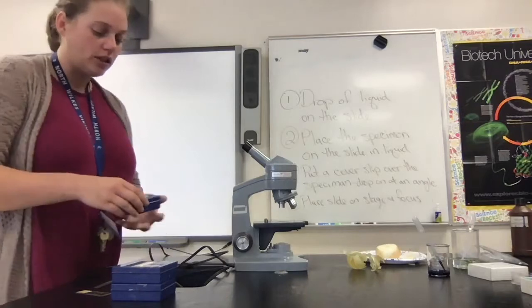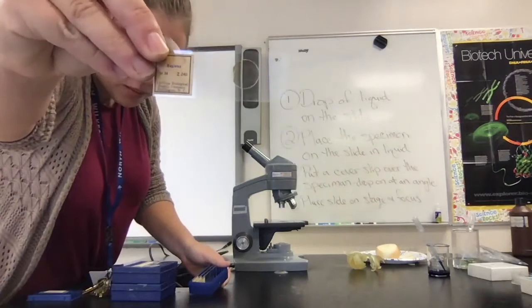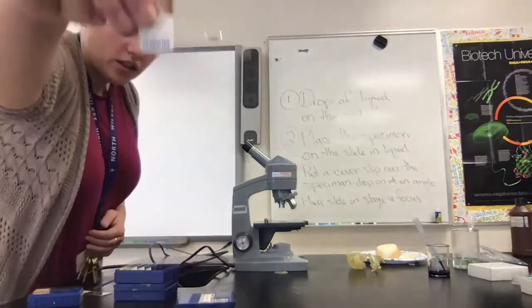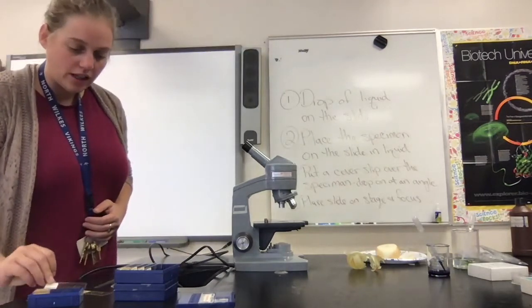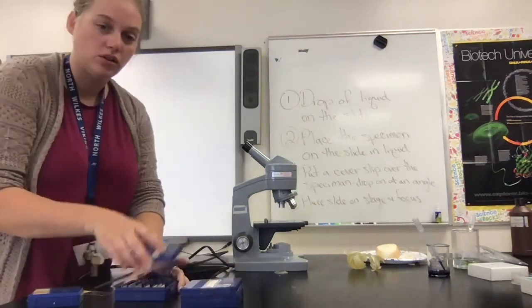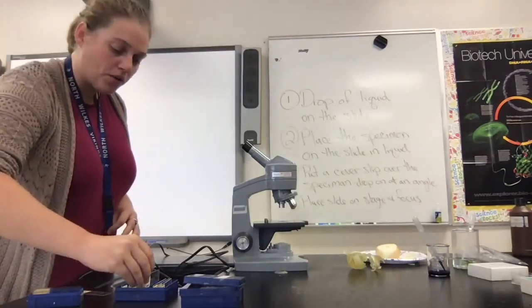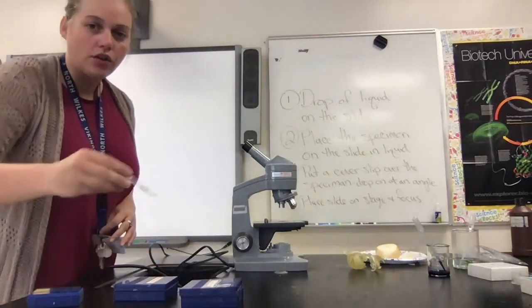So we're going to be looking at some slides today called Euglena, and you can see when you have a preserved slide that the name is going to be written on the slide for you. We're going to be looking at Paramecium, so you can see where that's going to be written on the slide. And notice that you can't see anything on these slides yet. We are going to have to get them under the microscope because these are unicellular organisms. We're also going to be looking at amoeba, and so these are the 3 big protists that you need to know for biology, but we're also going to look at one more called Volvox.